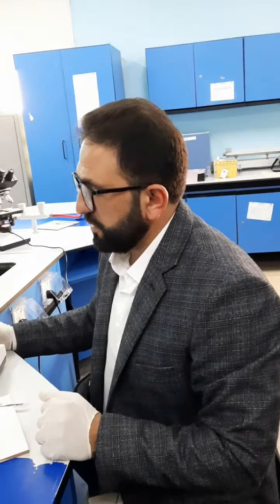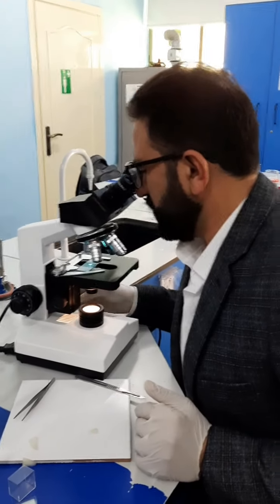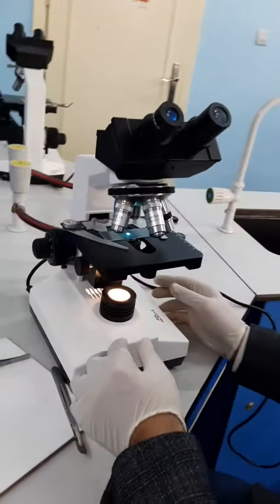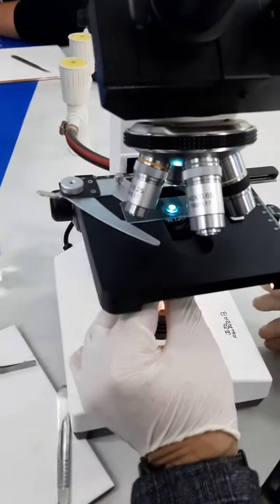It's better to use, there are some microscopes that have a camera fixed on them, so it's going to screen the view on the board. So I don't know if you can, guys, use the mobile camera in order to show the students the field of view. Can you come closer? Let's see if you can. I think, yeah, somehow like that. So basically, you're going to see cells. Let's forget about that. So here's the field of view.